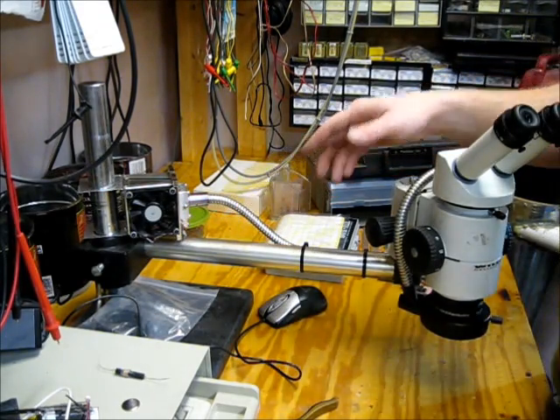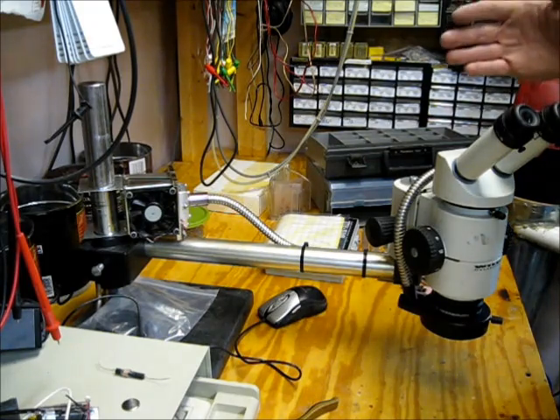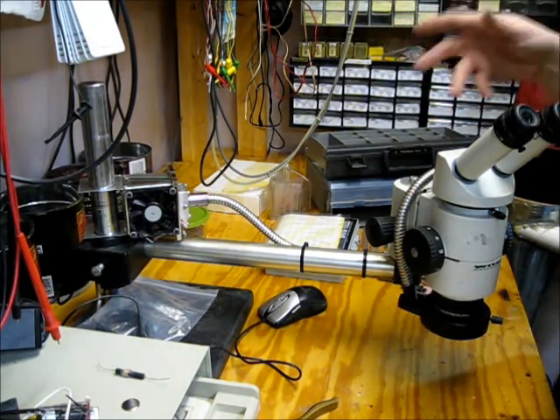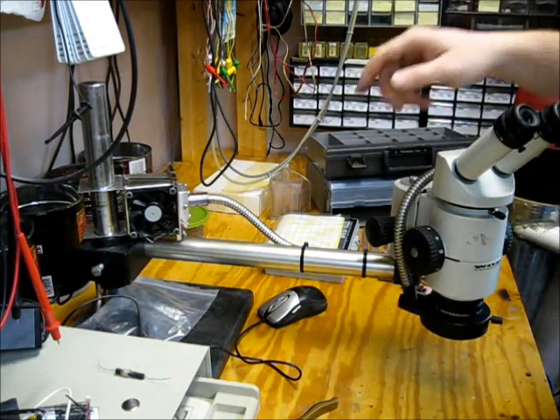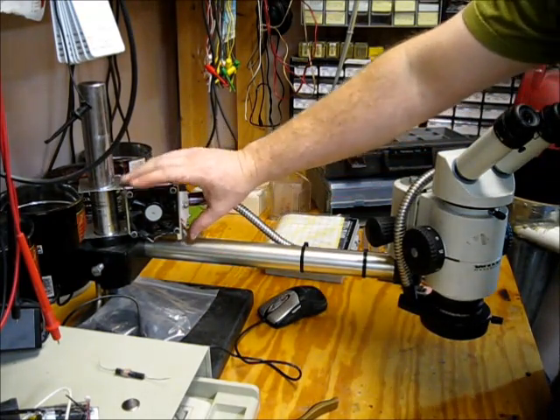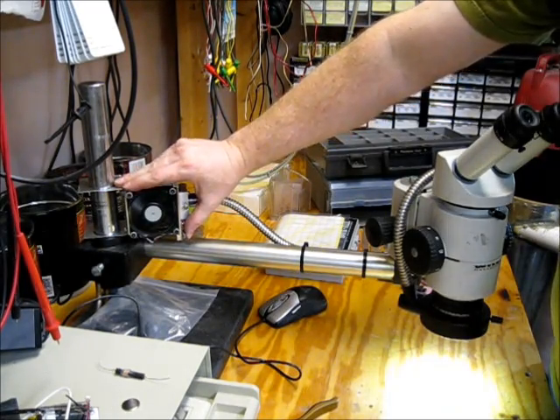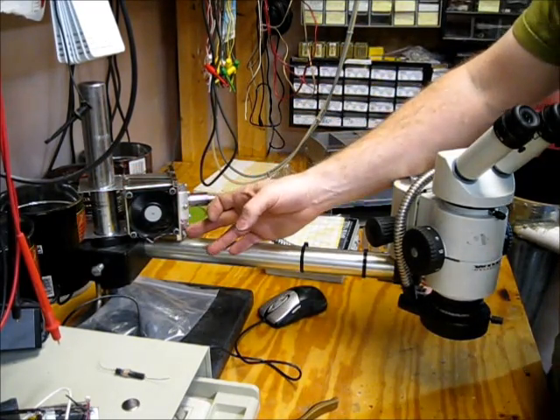So instead, what I did is I created a second output on this pin strip, which is PWM. For light levels 0 through 5, it's like 25%, and then level 5 through full, it's at 50% PWM duty cycle. So again, if you push both buttons, you go to full brightness. Push both buttons again, you go off.